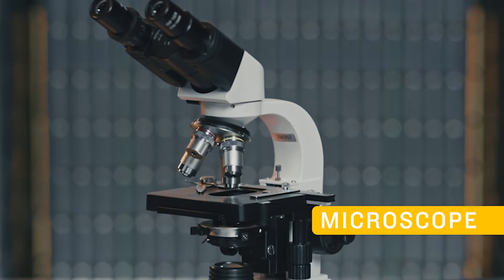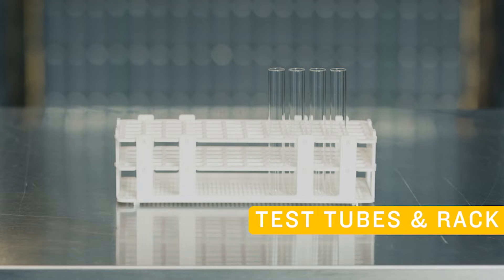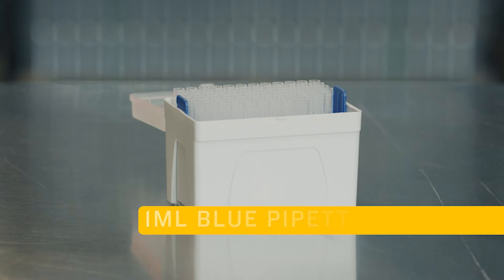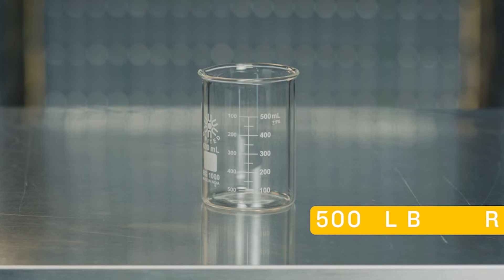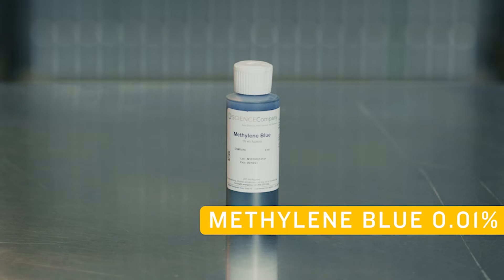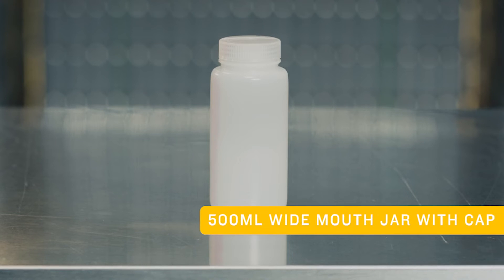To perform a cell count you will need a microscope, a hemocytometer, test tubes with a rack, a 1 milliliter auto pipetter, 1 milliliter blue pipette tips, a 10 milliliter pipette pump, 10 milliliter serological pipettes, kim wipes, a 500 milliliter beaker, a hand tally, methylene blue at 0.01%, a scale, and a 500 milliliter wide mouth jar with cap.